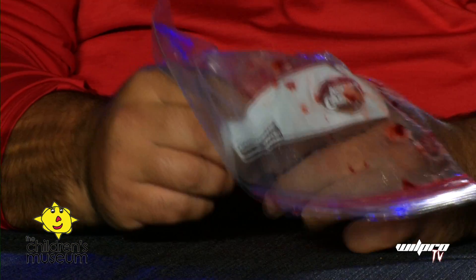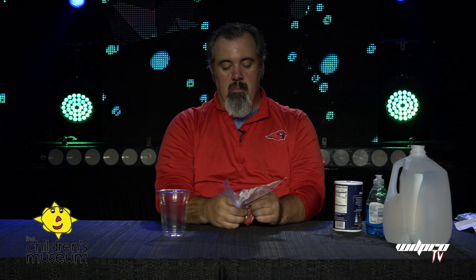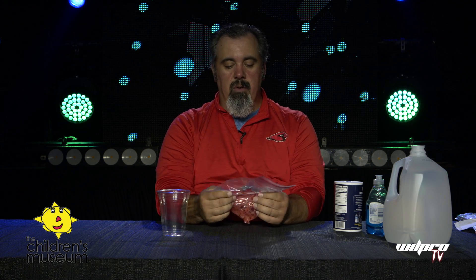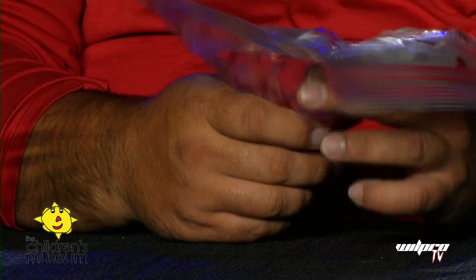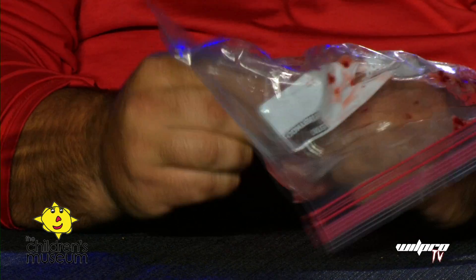There are millions and millions — billions — of cells in a human being, but inside this strawberry there are many millions of cells, and we're trying to rupture all those cells by smashing it together. Why would we want to do that? Well, DNA resides inside the cells, inside the nucleus, so we want to get it out, and we're going to use a couple of chemicals to do that.